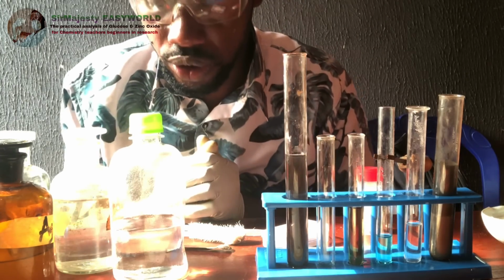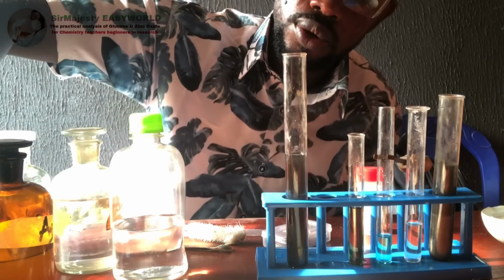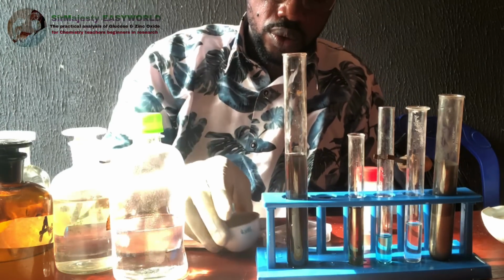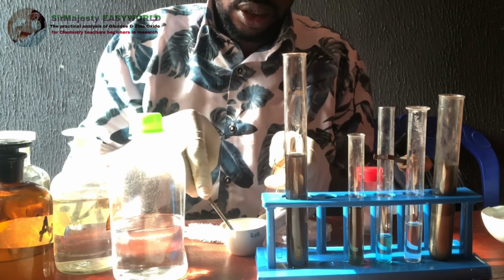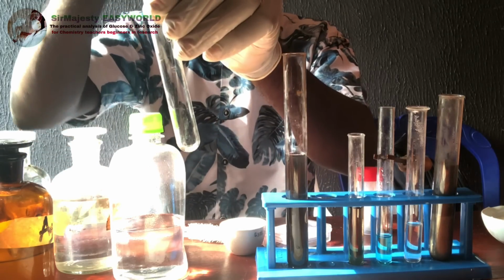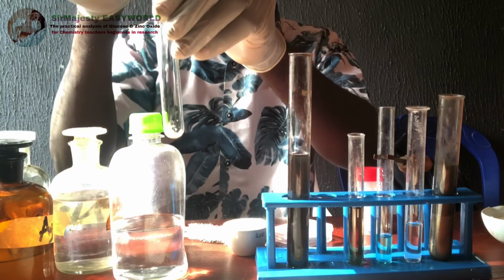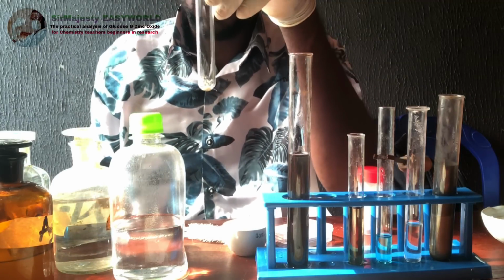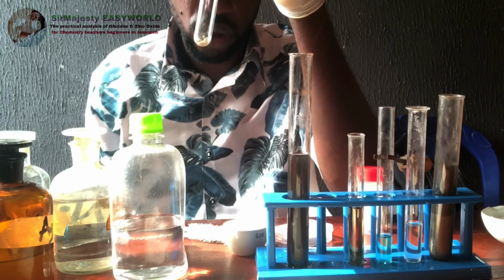So right now I want to show you what to do if you have pure zinc oxide. So over here is expected to be the zinc oxide, which we have shown you what happens on heating and then on cooling. So I'm collecting a sample of it. Remember, zinc oxide is insoluble in water, unlike glucose that is soluble. So you might be required to test the solubility of zinc oxide in water, in acid, and in base. I'll show you those here now.